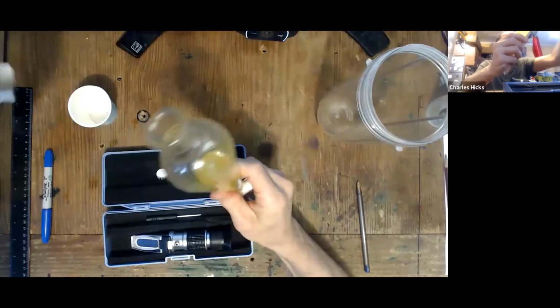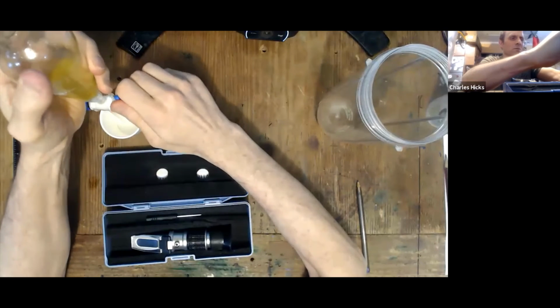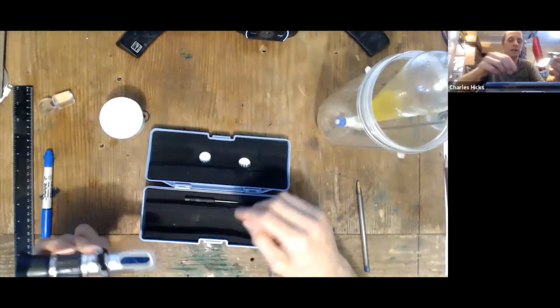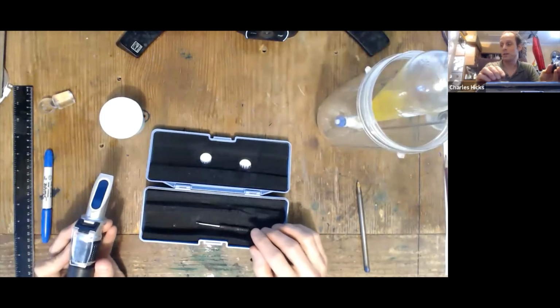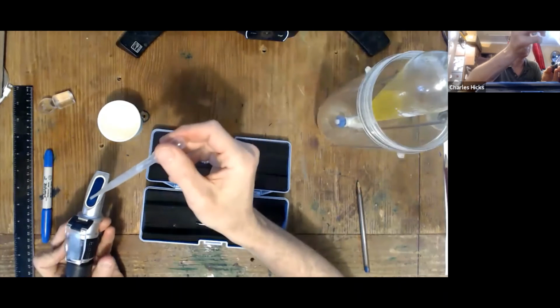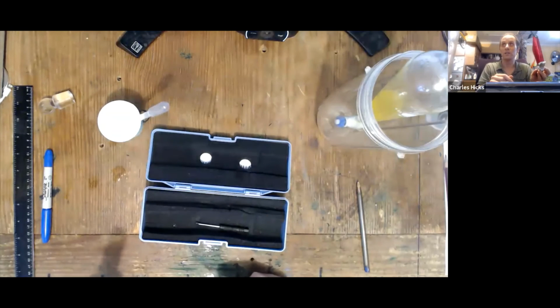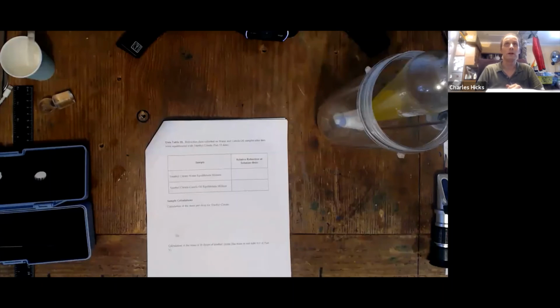So I'll take the stopper off here, and I'm going to drain off some of the water layer into a small Dixie cup. And we only need a few drops for the experiment. You should follow the same procedures you did last week to calibrate this first with water, because the temperature in the room is probably different than it was last week. And then take a clean dropper, sample some of this water layer that has the triethyl citrate in it. And again, make a measurement of that refraction, and that value gets recorded in a different data table. Okay. That value will get recorded in this table here.